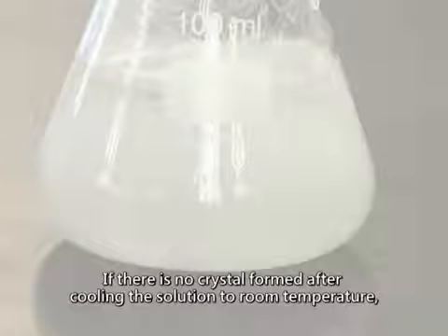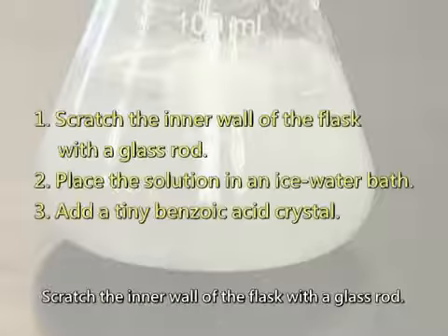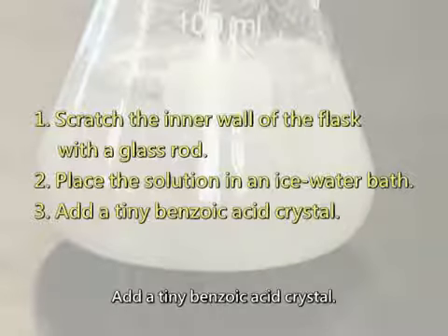If there is no crystal formed after cooling the solution to room temperature, the following methods may be used to induce crystallization. Scratch the inner wall of the flask with a glass rod. Place the solution in an ice water bath. Add a tiny benzoic acid crystal.